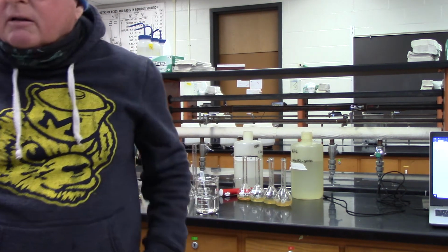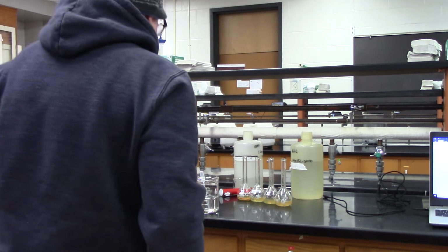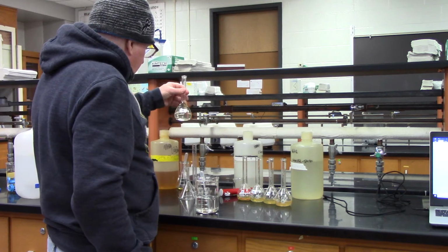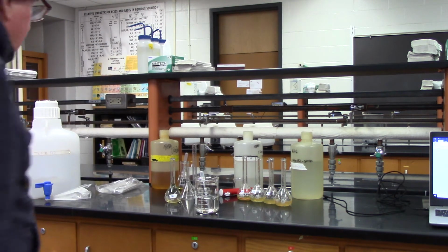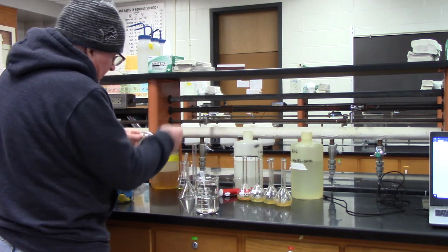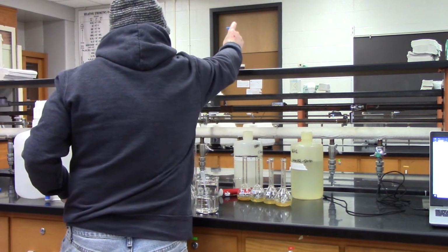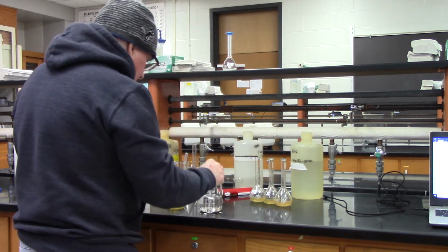Number one. Now, okay. I'd like to know what I just did with those caps. There they are. I want to mix them up. Number one done. Okay. Okay, number two. Same thing.